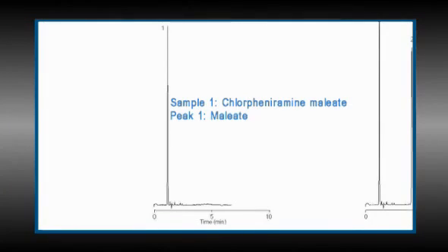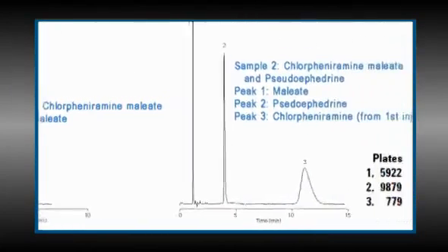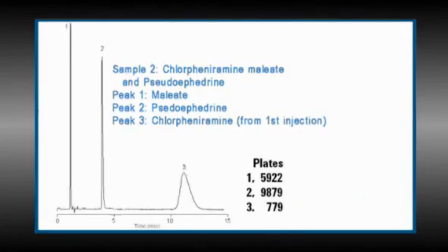The chromatographer running this analysis initially thought that she had coelution of chlorpheniramine and maleate, which, as I just mentioned, is not likely. She did another injection, adding pseudoephedrine, and obtained the results on the right. This is very confusing. She added a single component and got two extra peaks. Here's what really happened. Since we're running at basic conditions, pH 11, the first peak is maleate in the ionized form. The second peak is the pseudoephedrine, and after leaving the instrument running for a while, a third peak is also observed. The third peak is actually chlorpheniramine from the first injection, believe it or not.